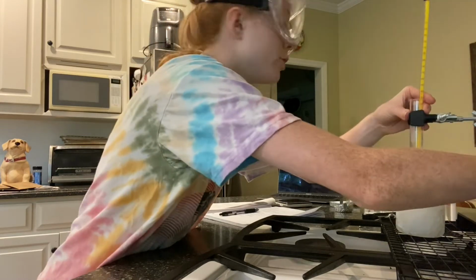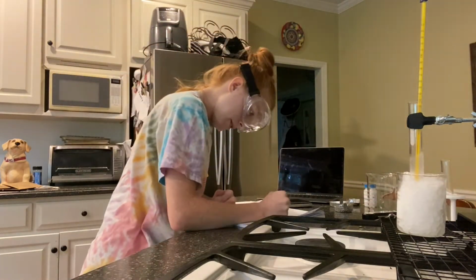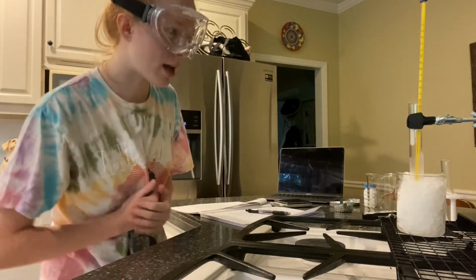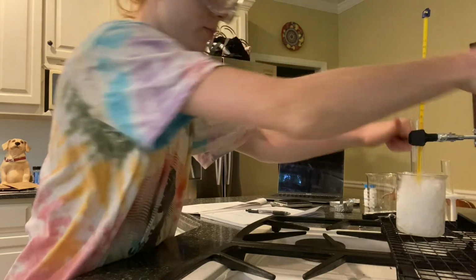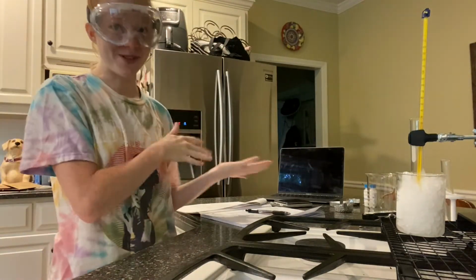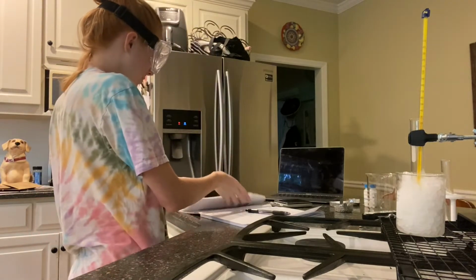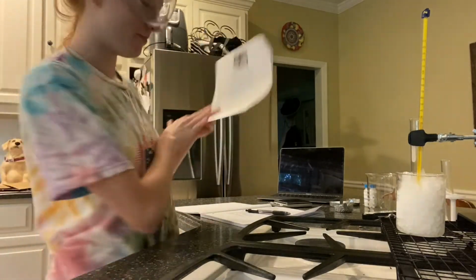And after 2 minutes, it's at 40 degrees. Now that I have completely frozen my paradichlorobenzene, I will remelt it so that I can use it to perform part C.